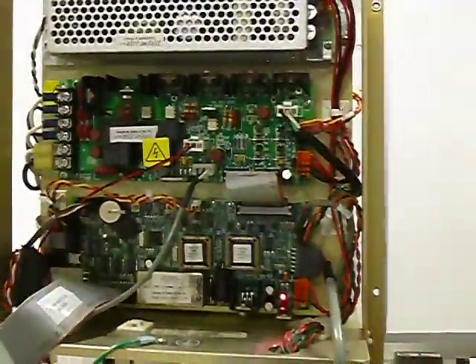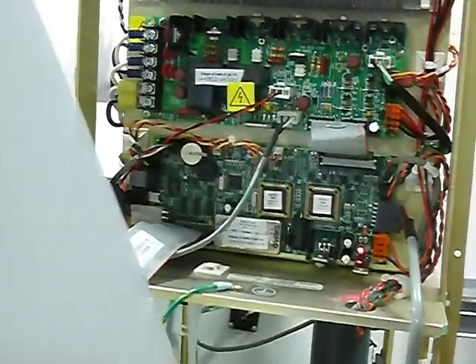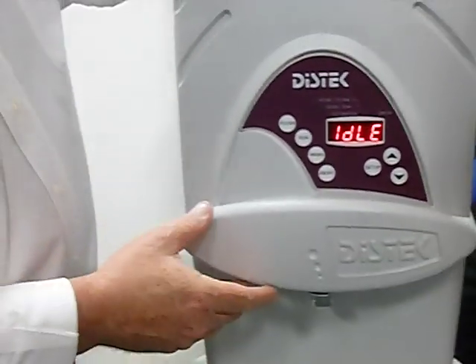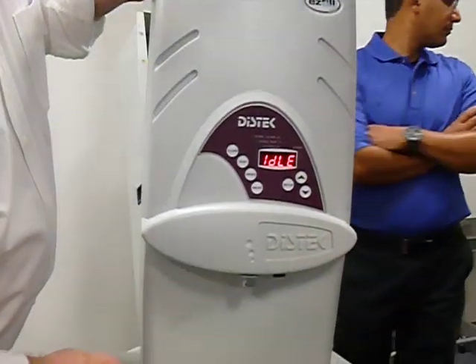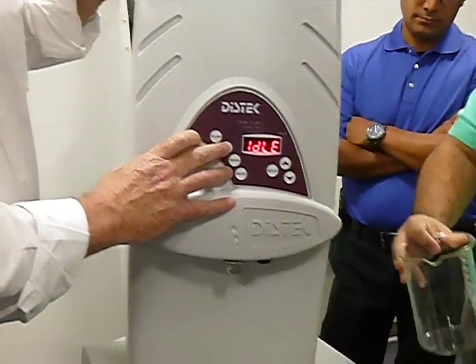Restart it. Front cover came out. Yeah, now it's ready. It's ready? Pass. Okay. And give me a beaker over there. And we're gonna hit run. Just put it under there.